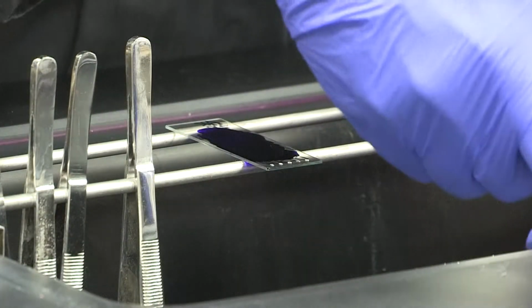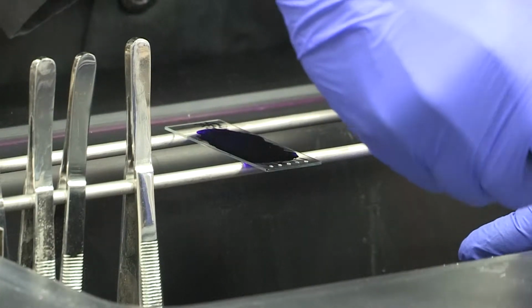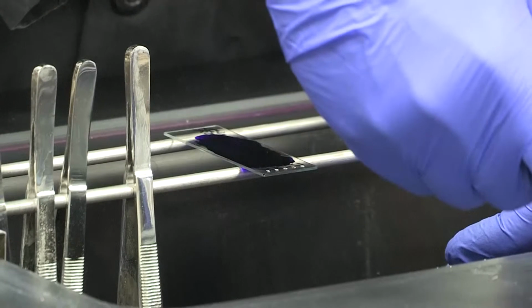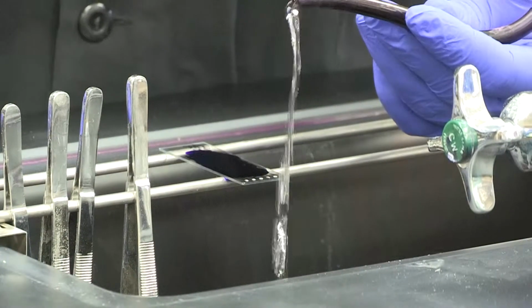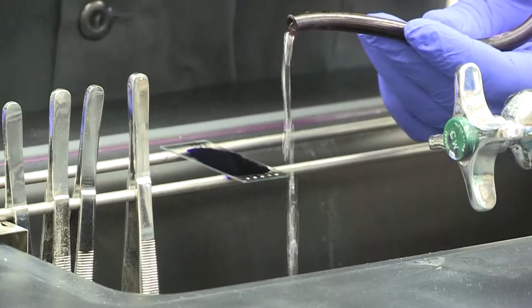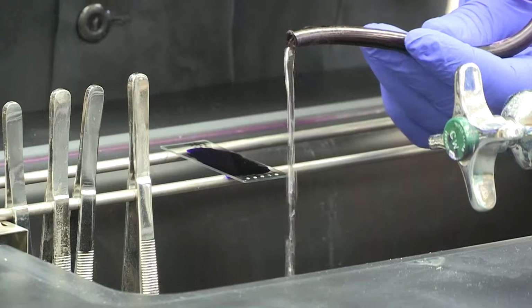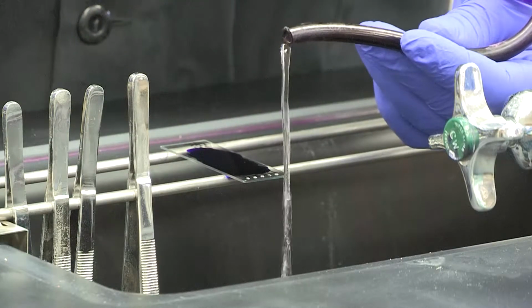Now, when you're rinsing off the dye, please keep in mind that you want to have it be a very, very slow trickle coming down the sink. Okay? So again, this is pretty good as far as the amount of water. You don't want to spray that directly onto the bacteria because remember, bacteria are very microscopic. This would be a fire hose if you did this directly to them.